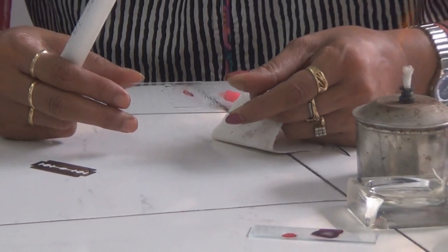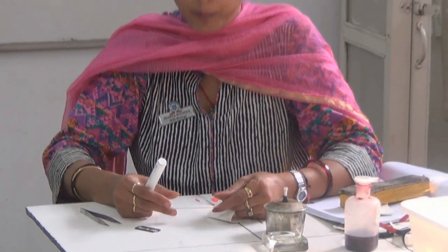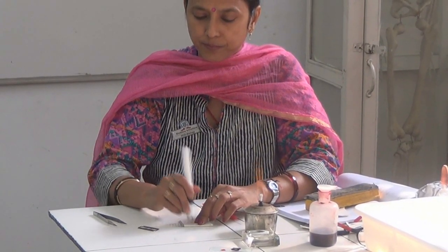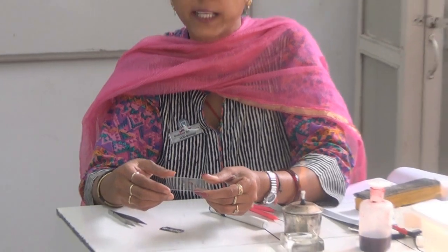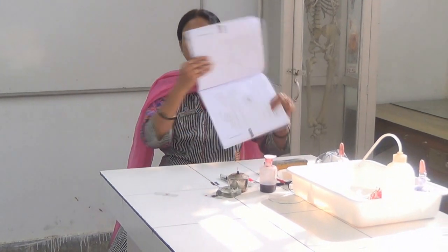Since there are a large number of cells in this slide, you will have to look for the stages in a proper manner. After observing the slide under the microscope, if you feel that the cells are still not separated, you can repeat the tapping. Under the microscope, you should be able to see the cells separated from each other — they should not be bound together. Once this is done, you are going to observe it under the compound microscope and you will observe different stages of mitosis.